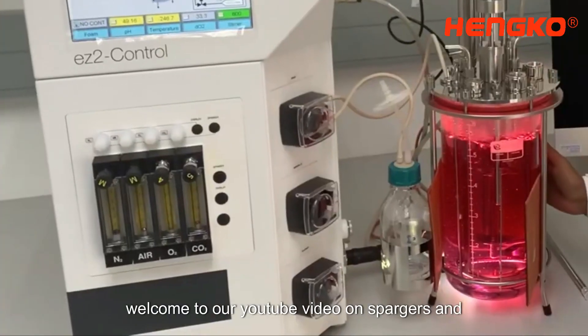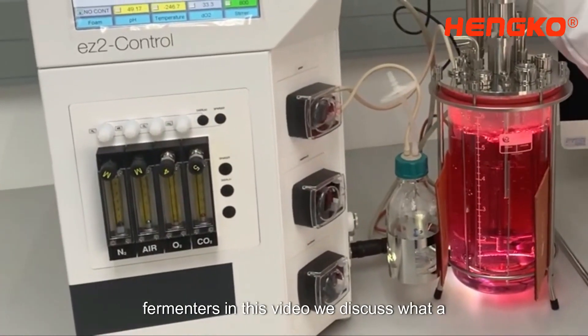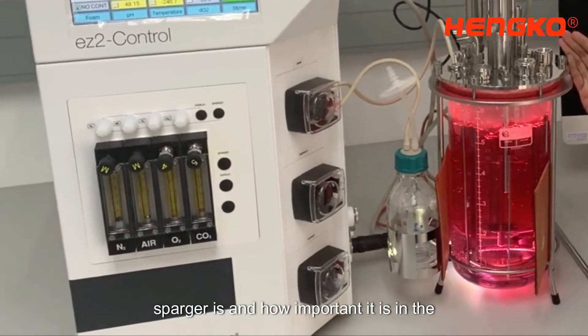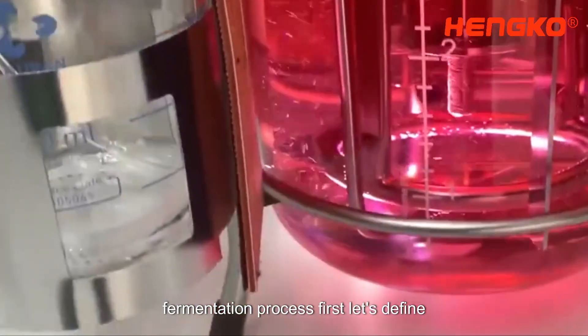Welcome to our YouTube video on spargers and fermenters. In this video, we discuss what a sparger is and how important it is in the fermentation process.